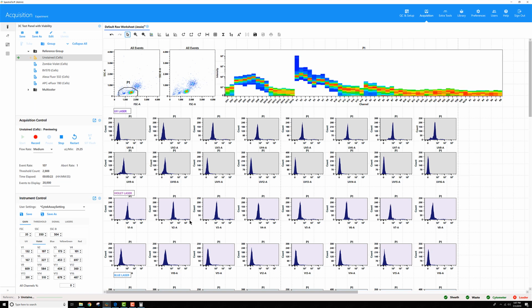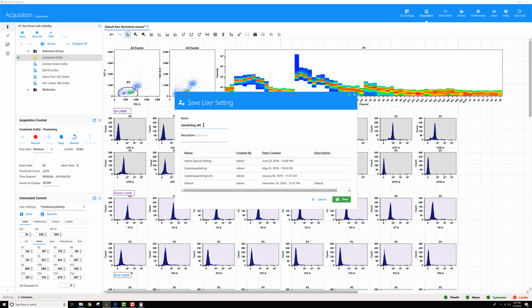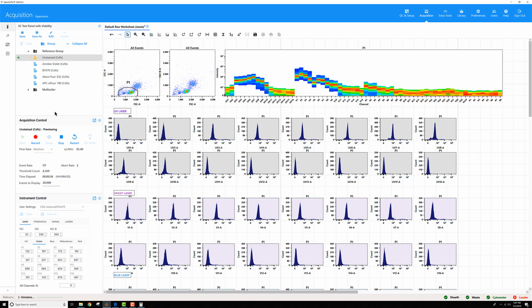Might be okay. I could save this as a new setting. It could be my Cytek assay setting, reduced V1 to V5. I could record this tube under the zombie violet, then I would want to record all of my other tubes at this same setting in my reference group.